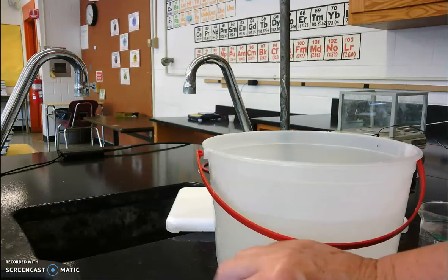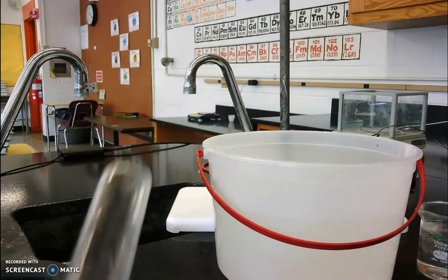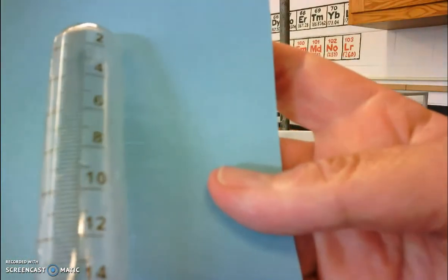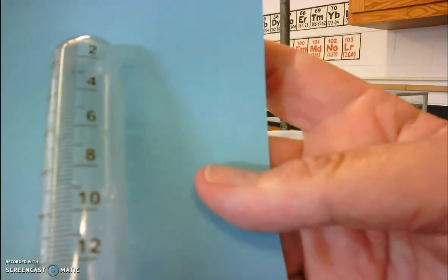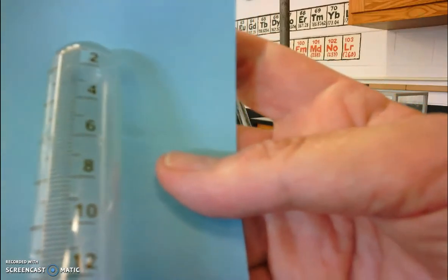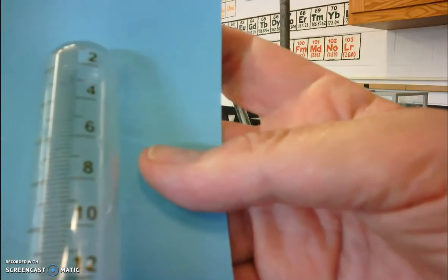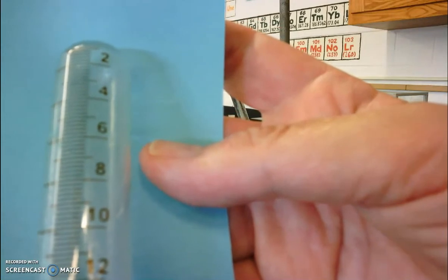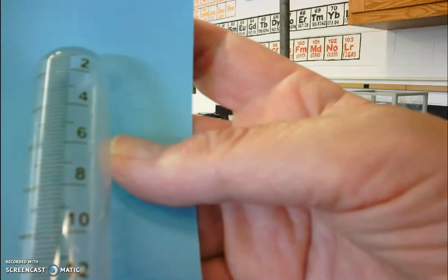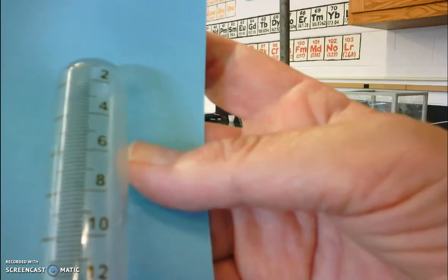And the hydrogen gas is going to be collected in what's called a eudiometer. And a eudiometer is essentially a long, thin tube that has numbers on it so we can record volumes. So we take a look at our eudiometer. It starts with 0 at the top, and then there are 2 milliliter increments. So we've got 2, 4, 6, 8, 10. In between each 2 milliliters is a line, which would be 1 milliliter. And then in between each 1 milliliter increment, there are 5 lines. So each line represents 2/10 of a milliliter.